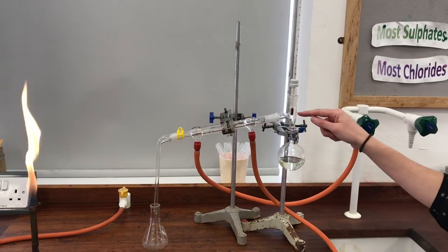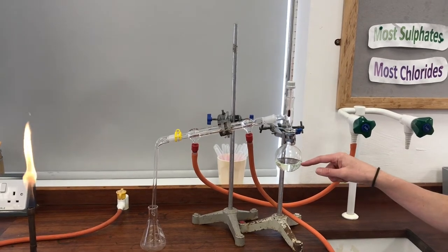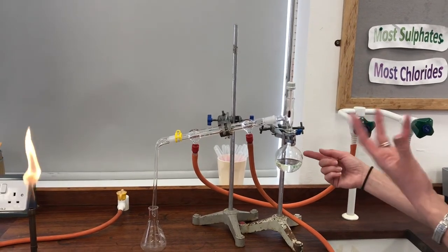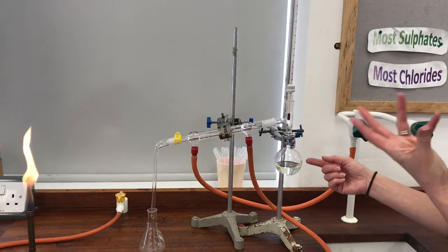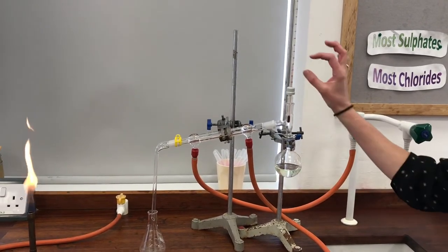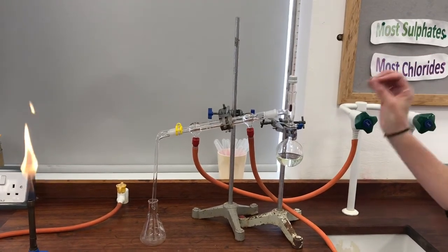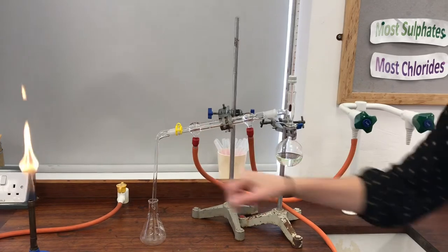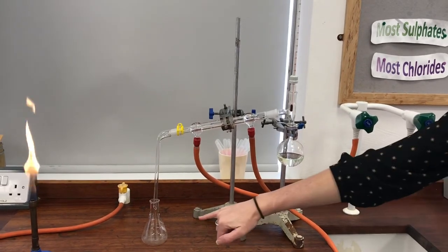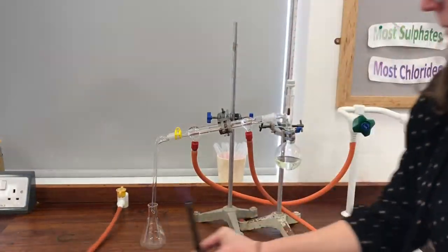So what I really want is to try to keep the temperature here nice and low around the boiling point of ethanol, so that I can be sure that anything that's coming over my system and collecting in my flask at the end is really just pure ethanol. So let's start heating it and we'll see how we go.